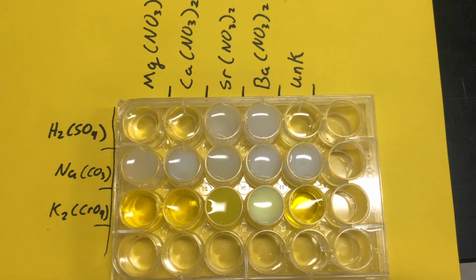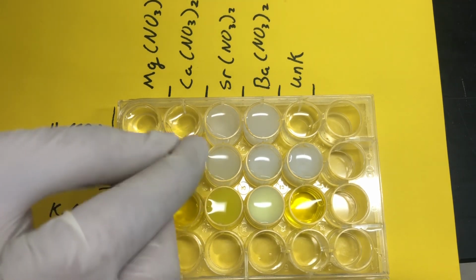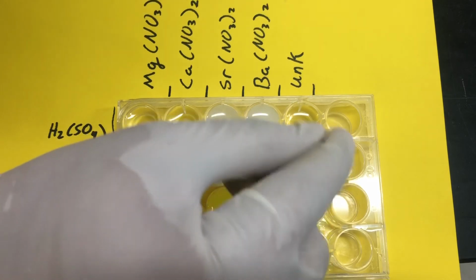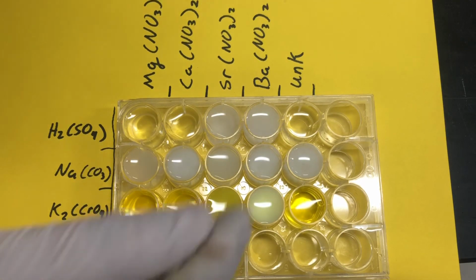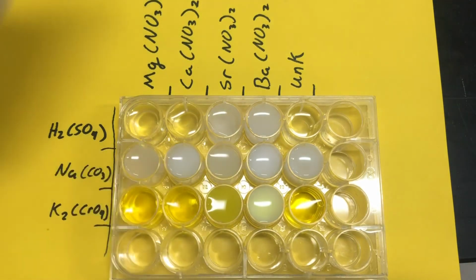Okay, so once again, if you could see right through it, that means that it is soluble. If it barely looks like there's some stuff in it, that means it's slightly soluble. All right, so I'll mix some of that stuff up with a little toothpick. So if there's barely any white stuff in there, that'll be slightly soluble, and if it's completely white, that means it's insoluble. But at this point, you should have enough information in order to complete that lab.